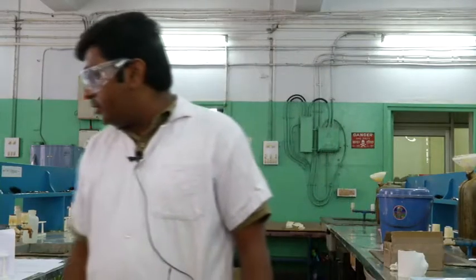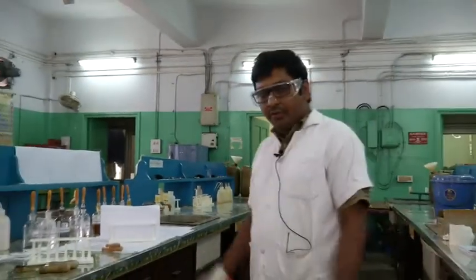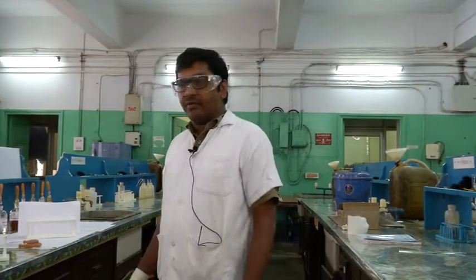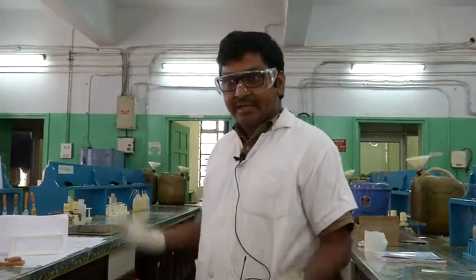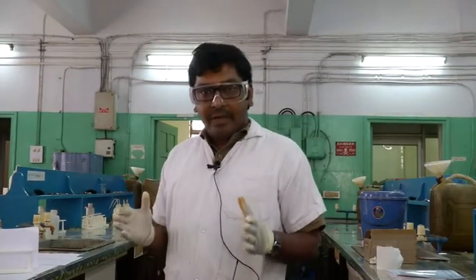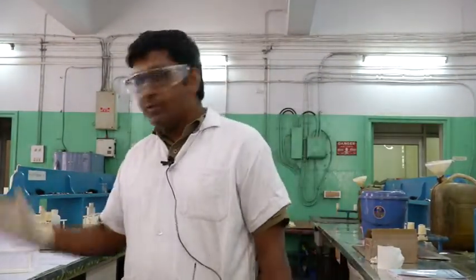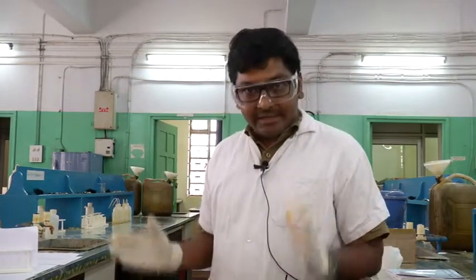Now I am going to show you the diazo coupling test for aniline. By this test we can confirm different kinds of aromatic amines, and today I will show the confirmatory test for aniline.